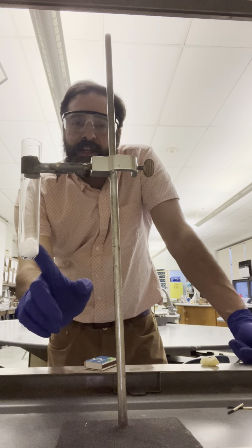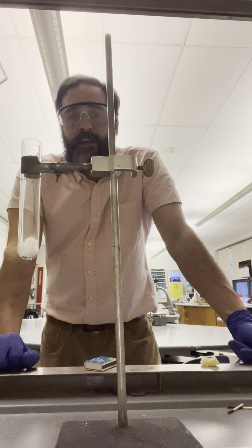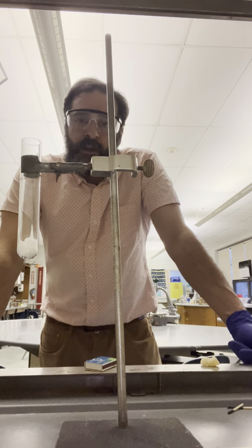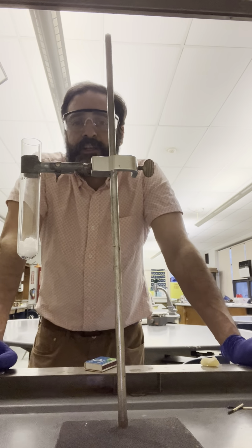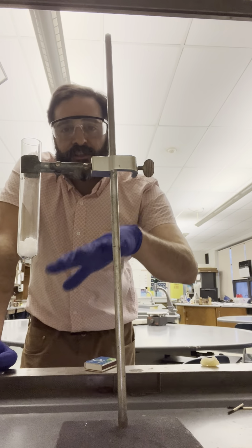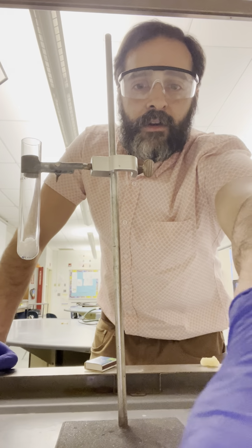What you guys are going to observe is this white powdery stuff is going to first melt into a liquid, and once it reaches a certain temperature, it starts to decompose. It will release oxygen gas up the test tube, so the test tube will fill with hot oxygen gas. This chemical reaction is slightly exothermic, and I'll try to demonstrate that to you once we get it going. The reason we know this is true is because once I get it to the point where we have enough activation energy to melt it and to start the decomposition, you can move the Bunsen burner away and the chemical will still continue to decompose.